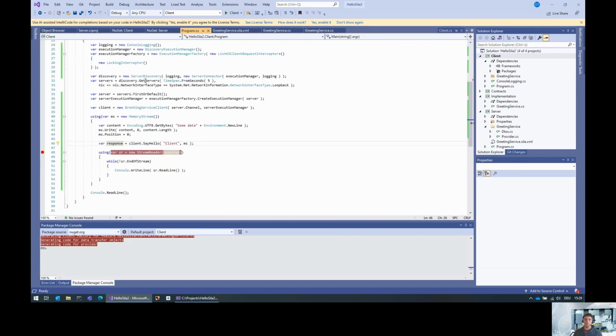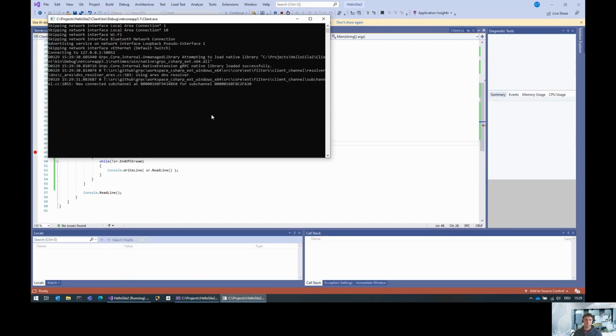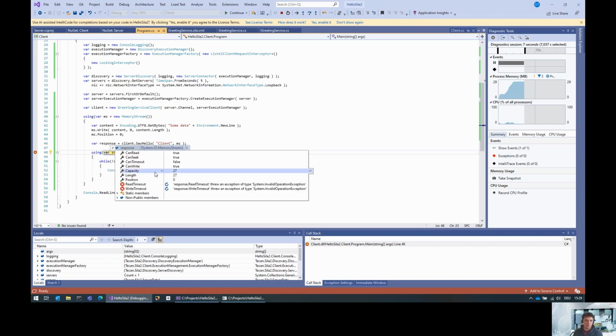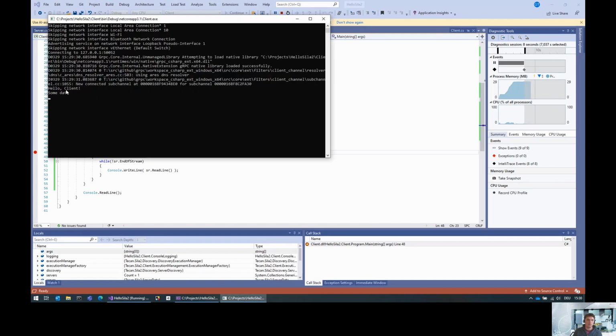Okay, so let's execute this. And here we are. And the response is a memory stream. That is because the data that we passed into it, the content here, is 11 bytes, and the total length here is, you see, 27 bytes. So that's basically nothing. And if we continue, then this will write this thing into the console: the greeting, hello client, and some data.